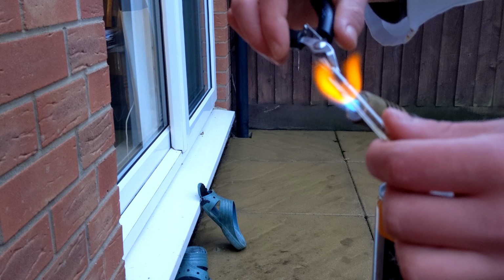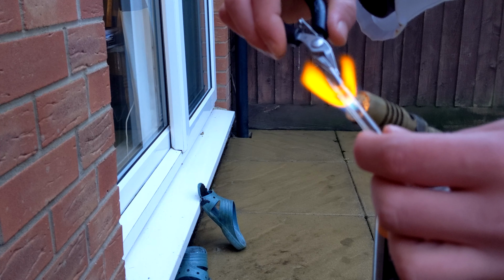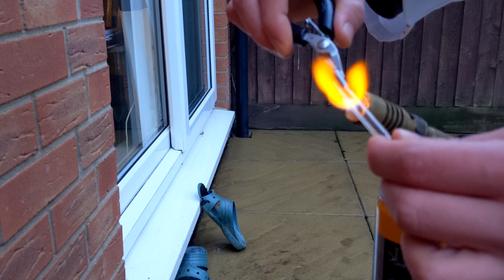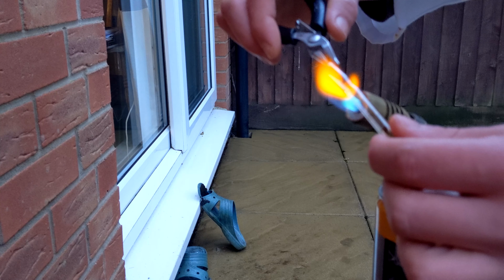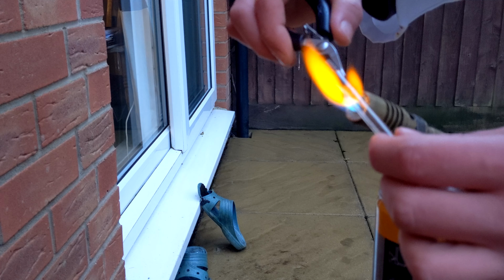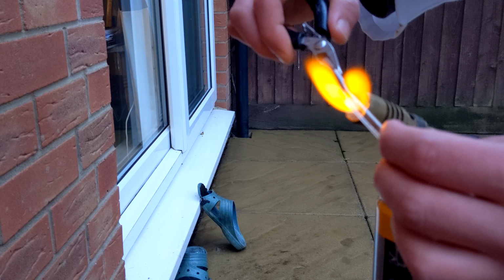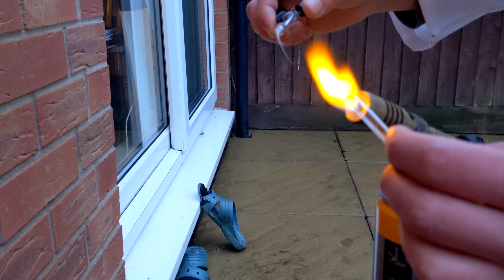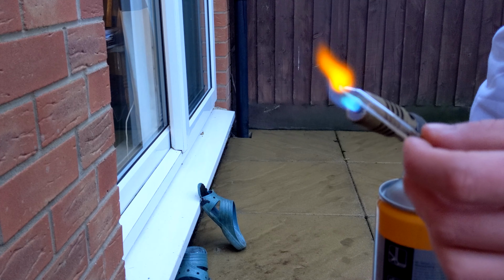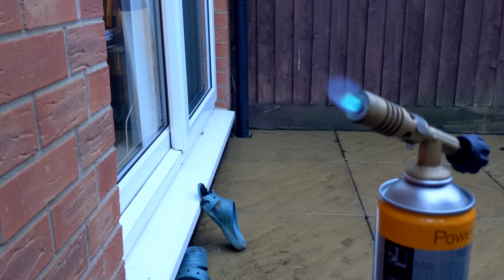So the idea is I heat the open end of the ampule with the blowtorch, and start pulling on it. As the glass melts and I pull it, it will neck in and seal itself, as I'm about to do here. So I pull the glass and it seals itself. Very nice. This actually takes a lot of skill, because if you heat it for too long, the air expands and you can't seal it properly.